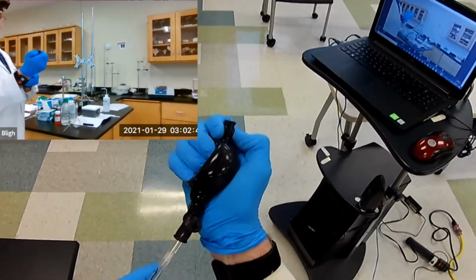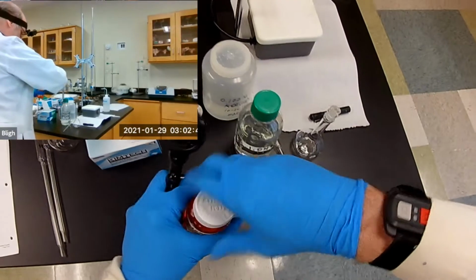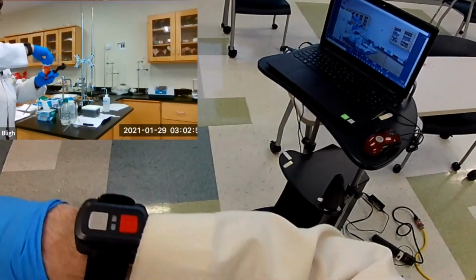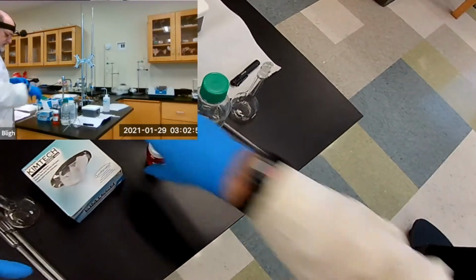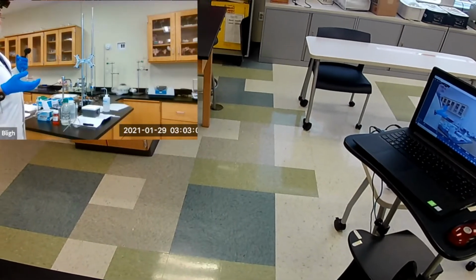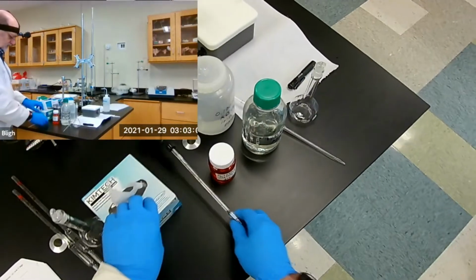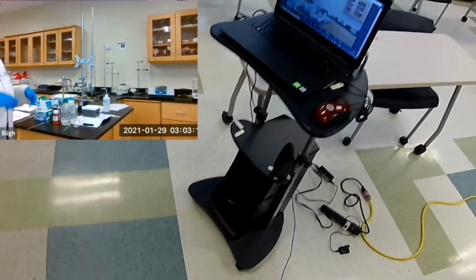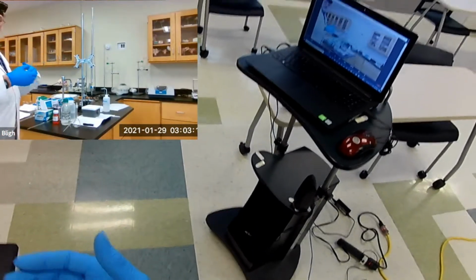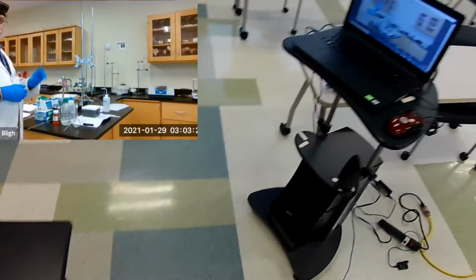All right. We need to prime the bulb. All right, there it is. And we need to open the container. And notice I have silver nitrate in an amber bottle. Silver will become reduced in the presence of light. So it's very sensitive to light. In fact, silver reaction to light is the whole basis for modern photography. Well, before we had CCDs in our cameras. When we had film in the cameras, yeah, silver was the basis.